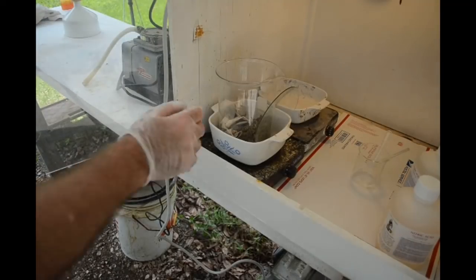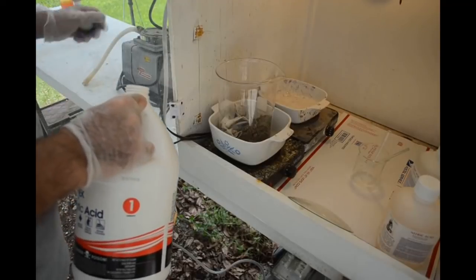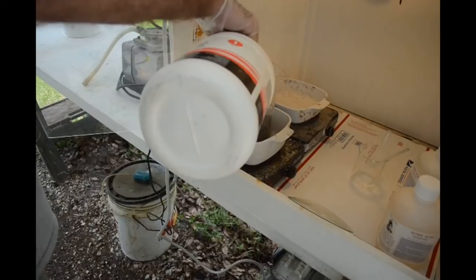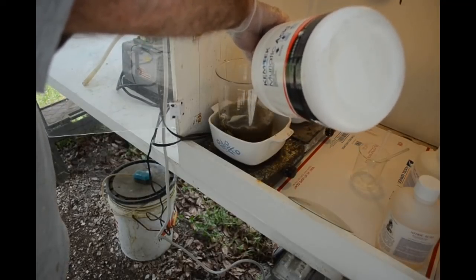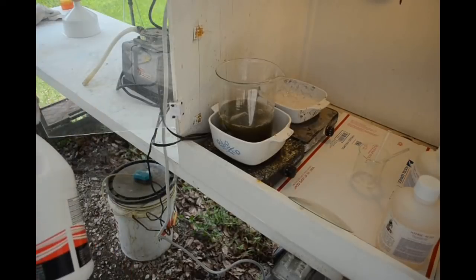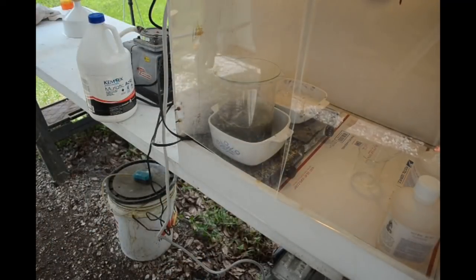Time to make aqua regia. I've got the solids in the beaker back in the fume hood on low heat. I'll add some hydrochloric acid — a goodly amount — up to about the 1000 milliliter mark. See that vigorous bubbling? I saw some little silver-looking bits in there which I assume are aluminum. Sometimes the inside of the chips have some aluminum in them. The nitric acid isn't going to digest the aluminum, but the hydrochloric acid is going to attack it pretty vigorously. I'm not too worried about a little aluminum contamination because the aluminum salts will wash out later.